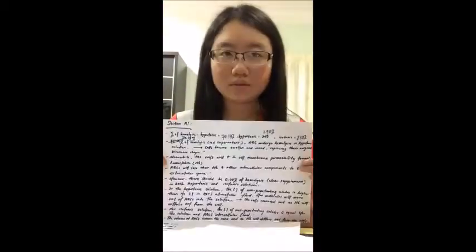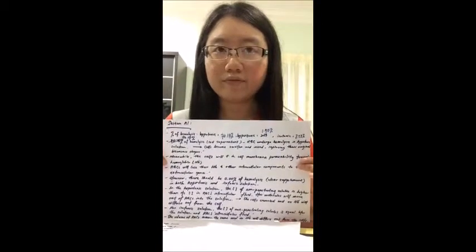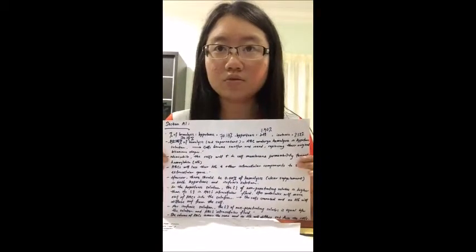While for the isotonic solutions, the concentration of non-penetrating solutes is equal between the solutions and the red blood cells' intracellular fluids. The rate of water moving in and out of the erythrocytes is the same, so there is no net movement of water into the cell. However, from the results we obtained, there is 1.90% of hemolysis for hypertonic solutions and 2.58% of hemolysis for isotonic solutions. So these results obtained are close to 0.00%.